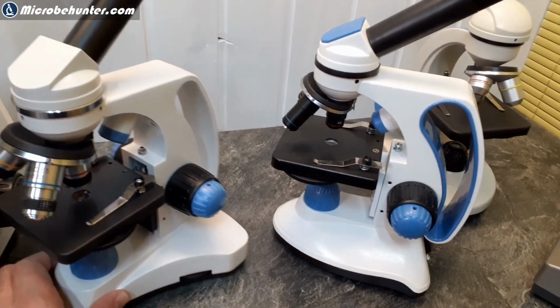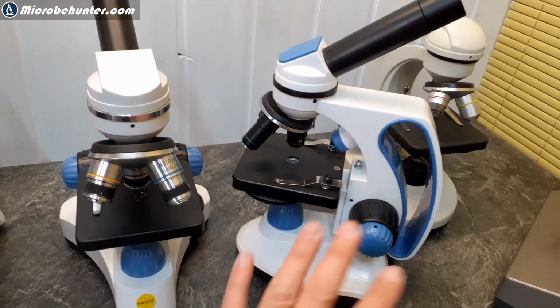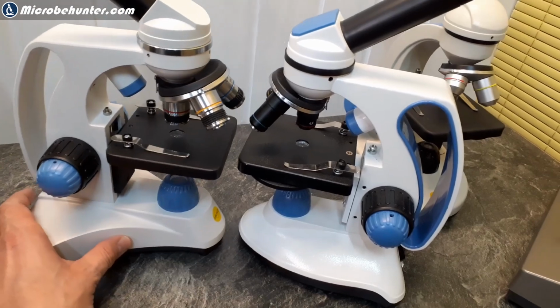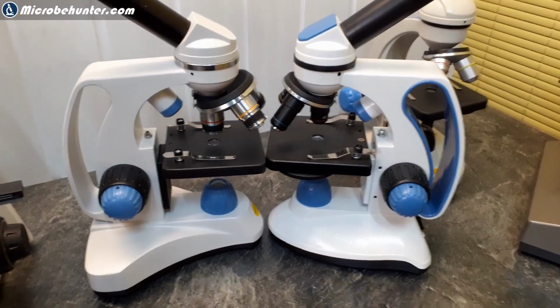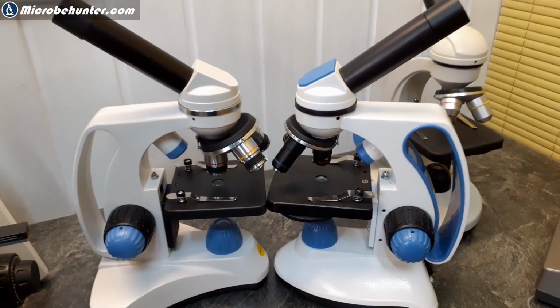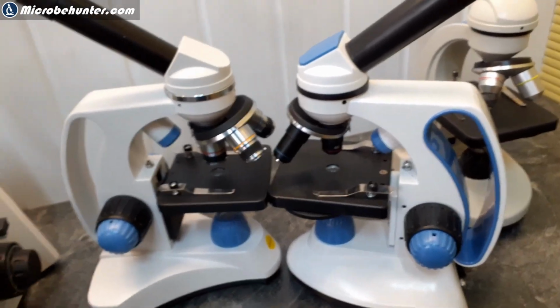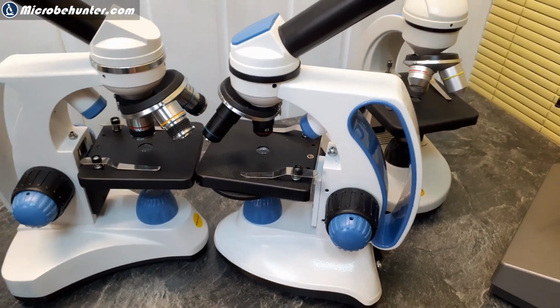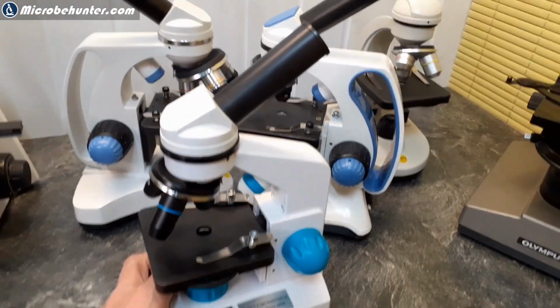But what I wanted to make clear is that you might not always see a huge difference on the outside, but sometimes it's the accessories and the support that also comes along. See, very similar otherwise. So all of those microscopes I highly recommend, by the way. It only depends a lot on what emphasis you would like to place. And for example, if you want to buy a present for a child, then don't underestimate the importance of documentation. This one, for example, here is yet a little bit smaller.